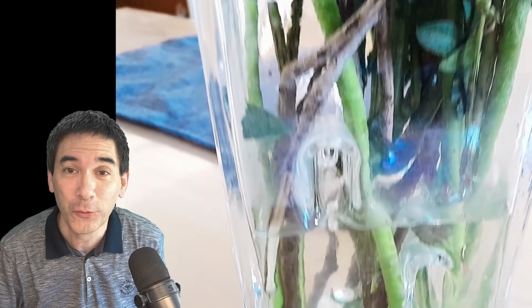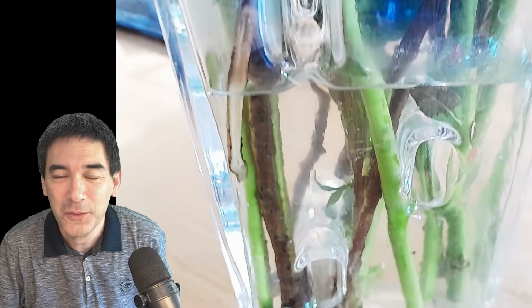And the problem with flowers like this is of course, they don't last very long. Obviously. So I said, how can I basically keep them for all eternity? Of course, you put them under the microscope and make a couple of nice videos on them. And then they're at least preserved virtually on YouTube. That's what I'm actually going to do now, is I'm going to put one of those flowers under the microscope.